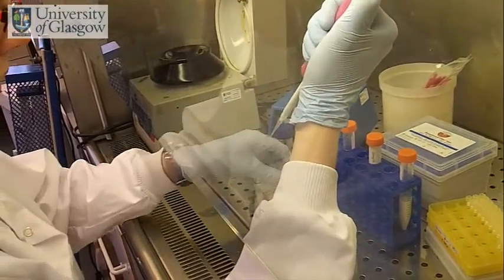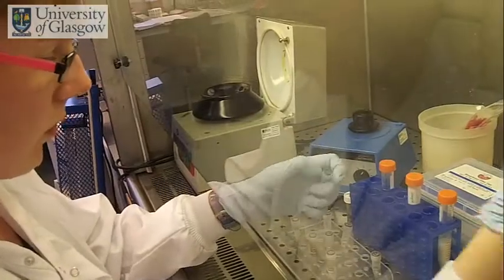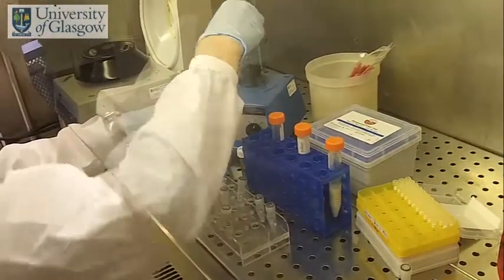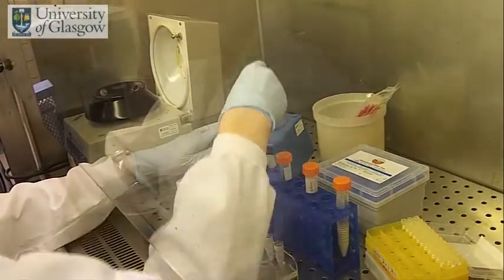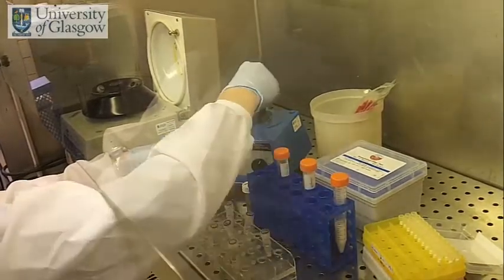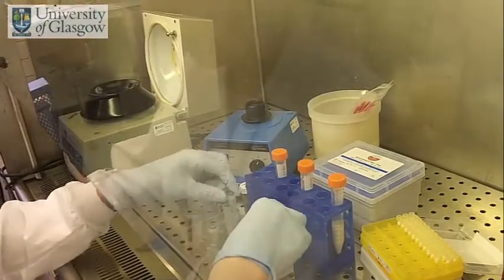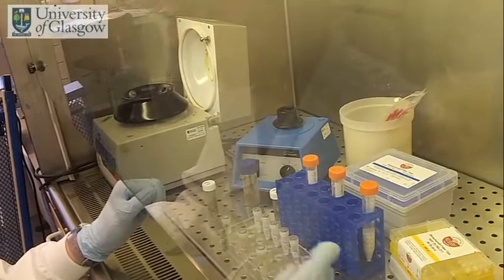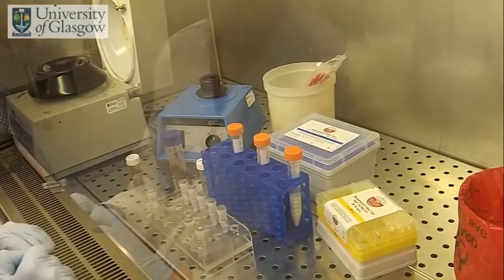So here we're diluting our supernatant in the respective samples, and again the only difference between the spike for the sample and the assay positive control is that we've added that small amount of our fecal supernatant to the spike sample. Once the samples have been added, give them a quick vortex to make sure they're mixed, and then the samples are all boiled for 10 minutes, and that's to rupture any virus particles that may remain and release the DNA into the liquid.